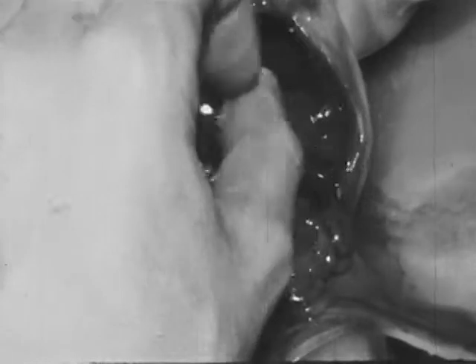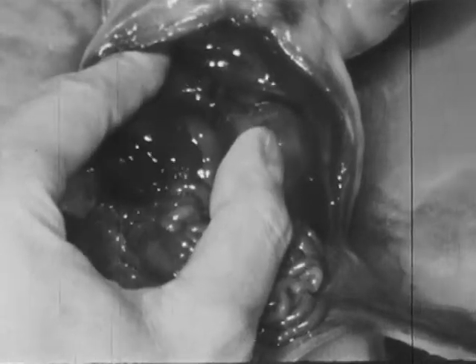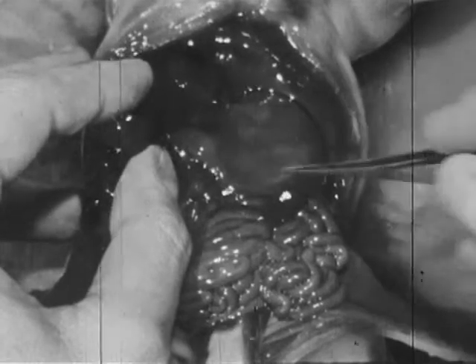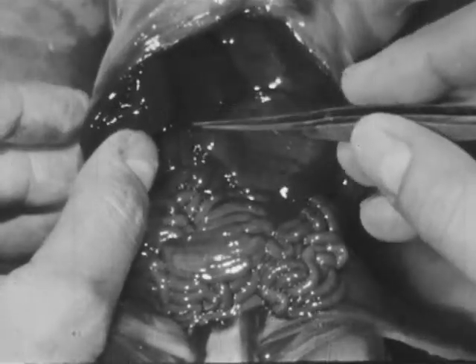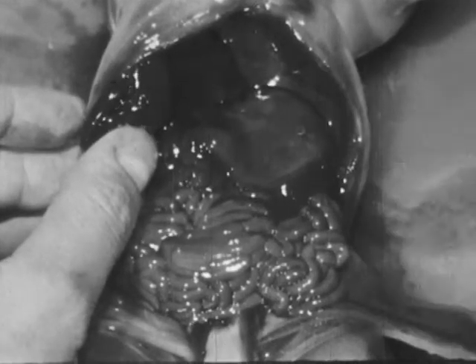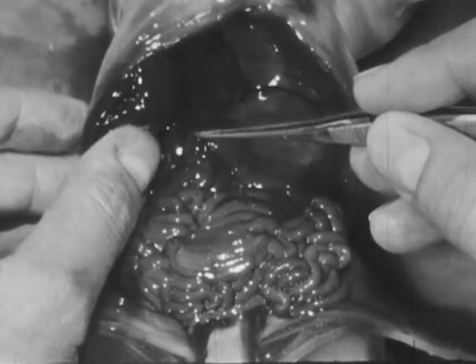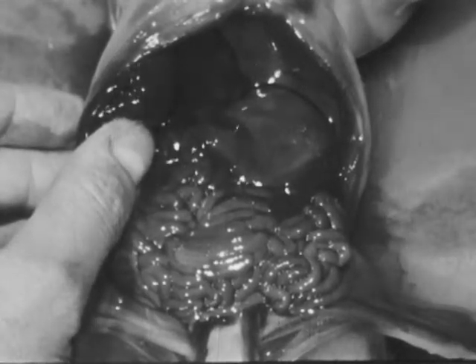Now the organs of the digestive system will be examined. Food taken in the mouth enters the esophagus. Muscular contractions of the esophagus move the food to the stomach, where early stages of digestion take place. The partly digested food passes from the stomach, through the muscular pyloric valve, and enters the first part of the small intestine, the duodenum. Here the food is mixed with secretions from the liver and pancreas.